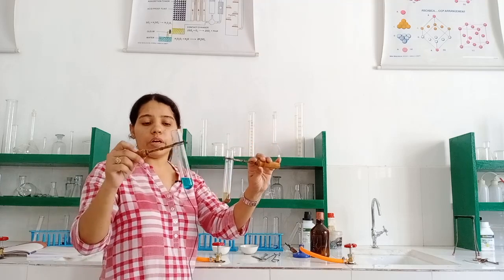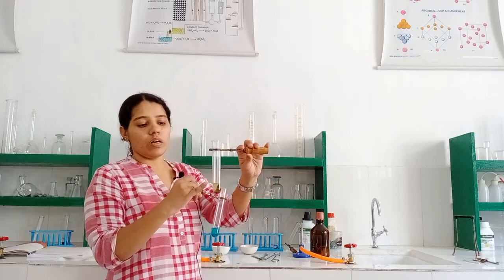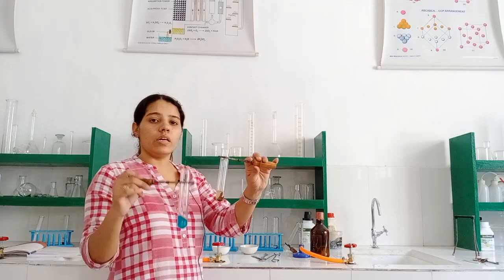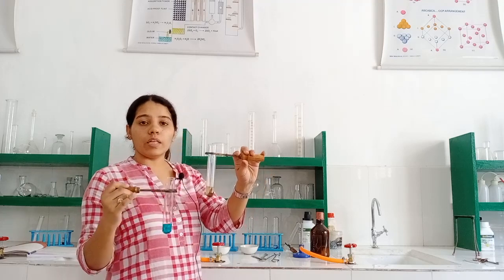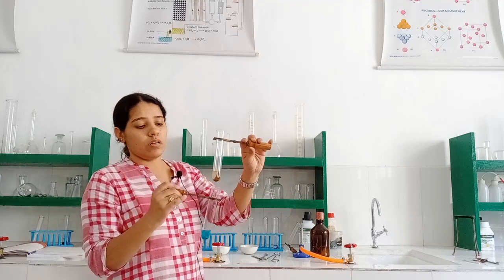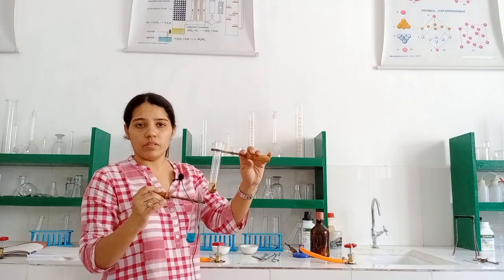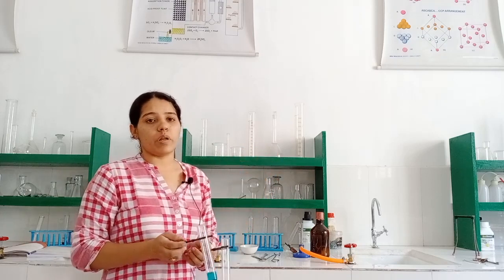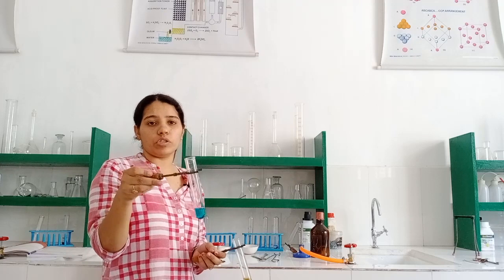Okay, so what will happen? We are having blue solution of copper sulphate here, but after displacement we are having a green color solution of ferrous sulphate, iron sulphate. That means the iron displaces the copper from the copper sulphate solution and forms ferrous sulphate, and the copper which is displaced from the copper sulphate solution is over the iron nails in the form of a reddish brown layer. Okay, so this is a displacement reaction, how the iron is able to displace the copper from the copper sulphate solution. This copper sulphate solution is a salt solution of copper.